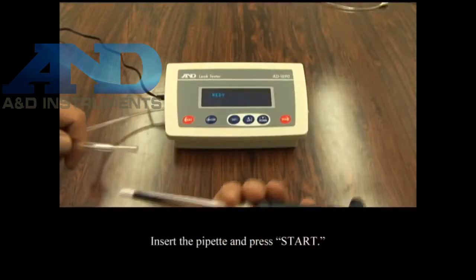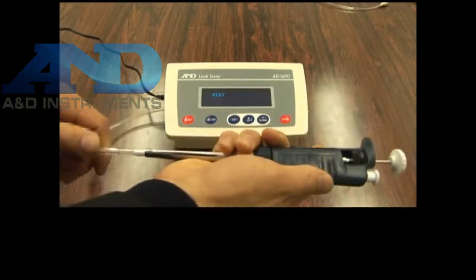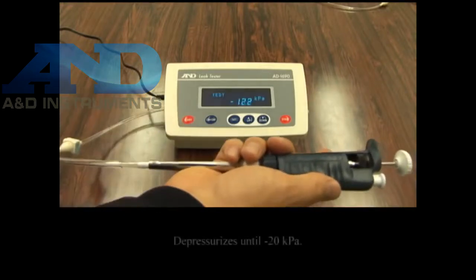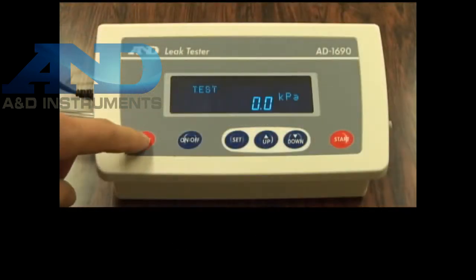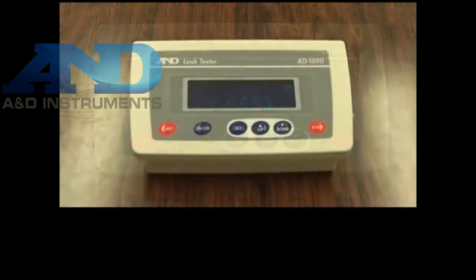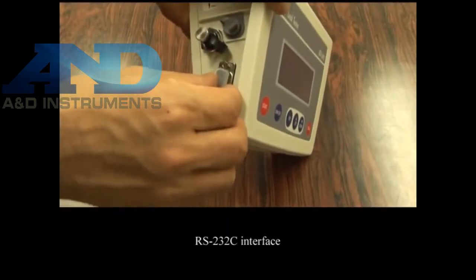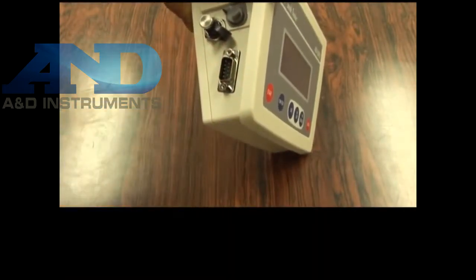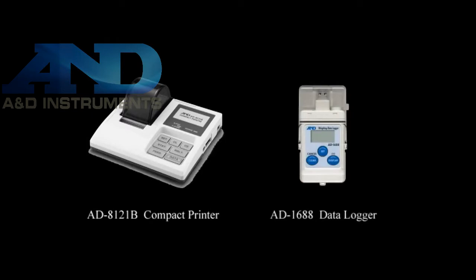Finally, insert the pipette into the tip of the attachment and then press the start key. The pump starts and depressurizes until -20 kilopascals. The AD1690 displays pass for leakage at or below the set value and fail for leakage above the set value. The AD1690 is equipped with an RS232C interface, so the data can be output to a PC or an A&D peripheral device such as the AD8121B or AD1688.